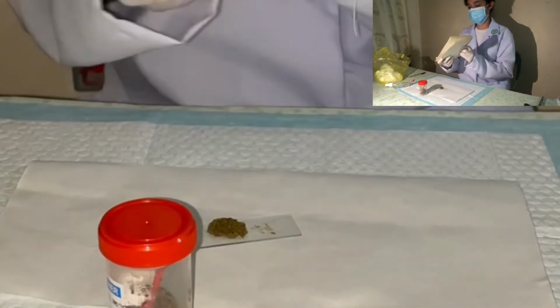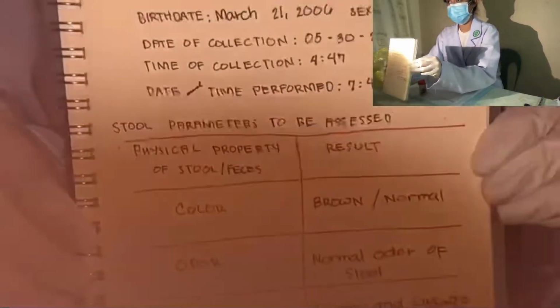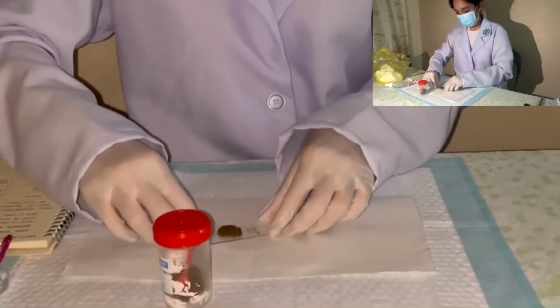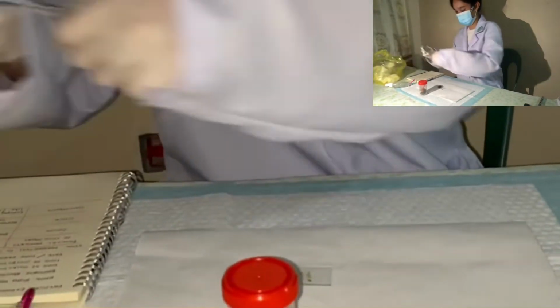After completely examining the specimen, we'll just jot down the information that we collected through this procedure. After the procedure, dispose of all of the materials properly.